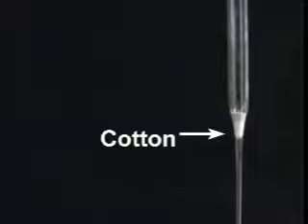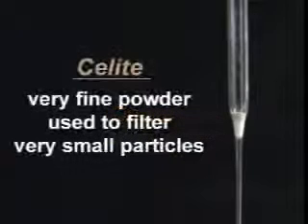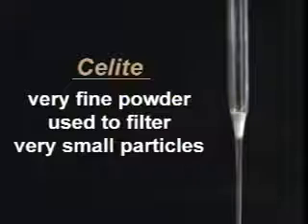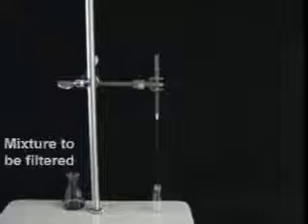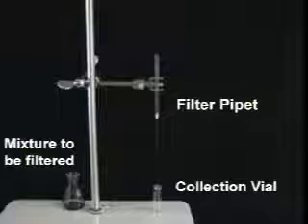But let's add something extra. As you can see, here is the cotton, but sitting on top of it, we've placed Celite. What is it, you may ask? Celite is a very fine powder used to filter very small particles. We'll be using it in this filtration. Now for the setup. Here we have the mixture to be filtered, and here we have our filter pipette, which is securely clamped to a stand, and we've placed a collection vial underneath it.